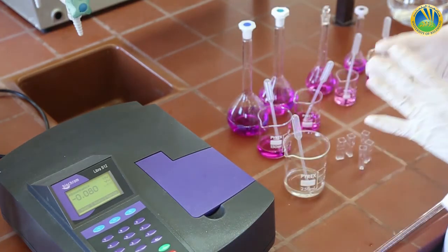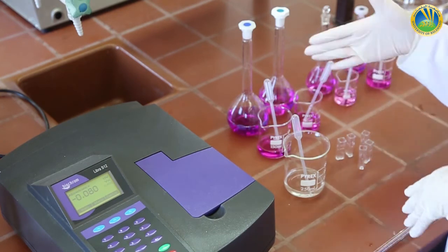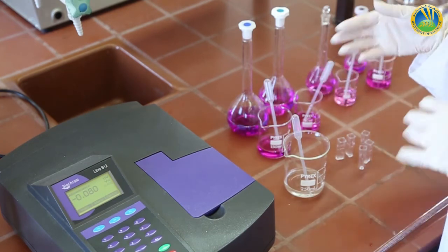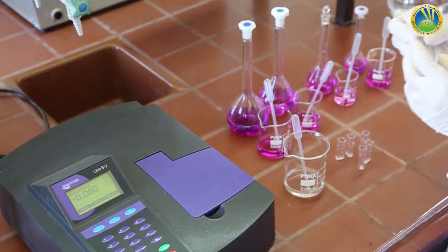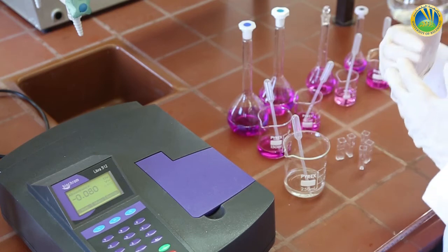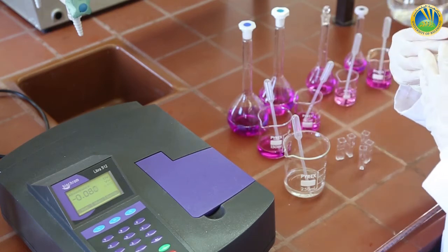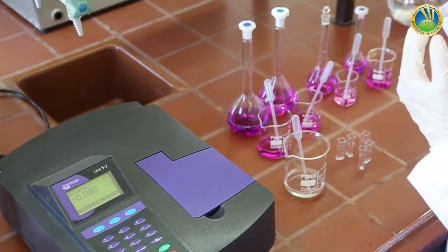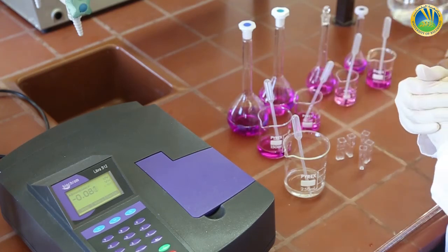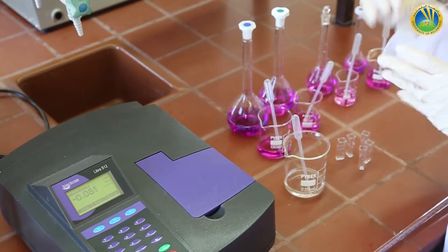As they have given us the wavelength 525 nanometer to measure the absorbance of the prepared solutions, this wavelength is the best wavelength, reflecting the maximum wavelength. Since they have done the job on our behalf, they have done what we did with the chromium nitrate solution when we chose the best wavelength.